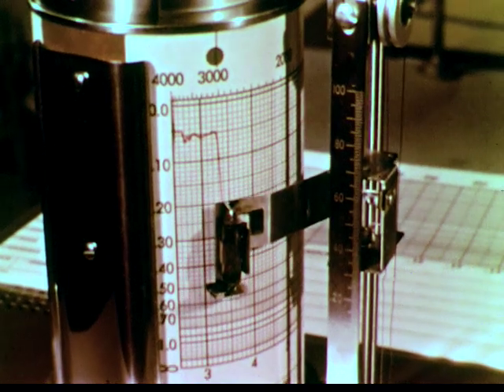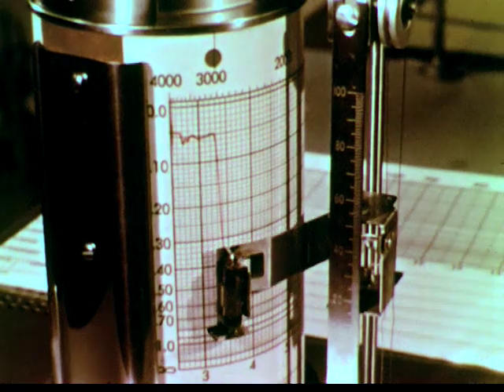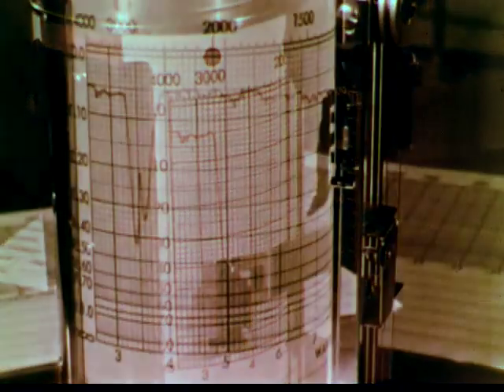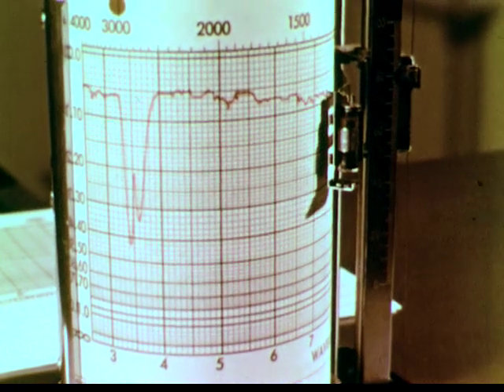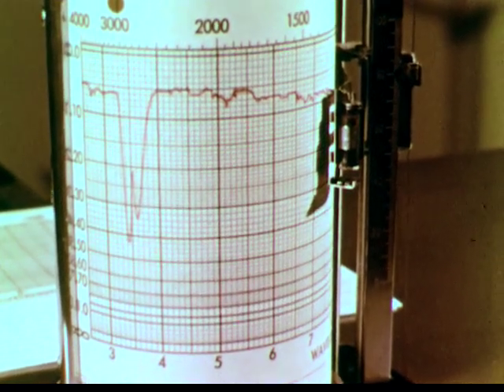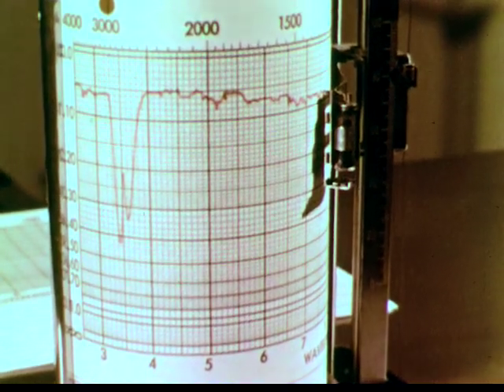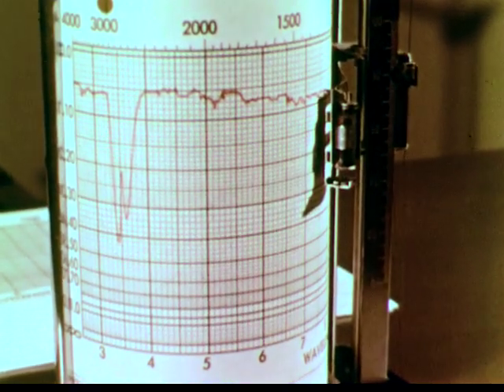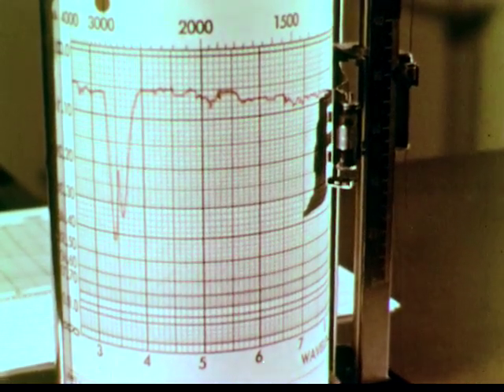The quanta absorbed have an energy of about 9 kilocalories per mole. At lower frequencies, the HCl is again transparent. Now we must ask ourselves why a nice simple diatomic molecule like HCl would have such a spectrum as this. According to our model, light involves wave motion.